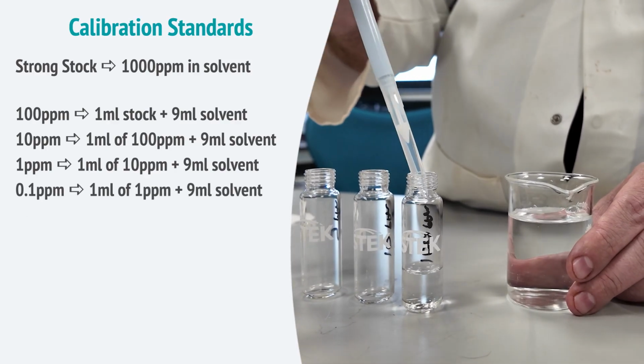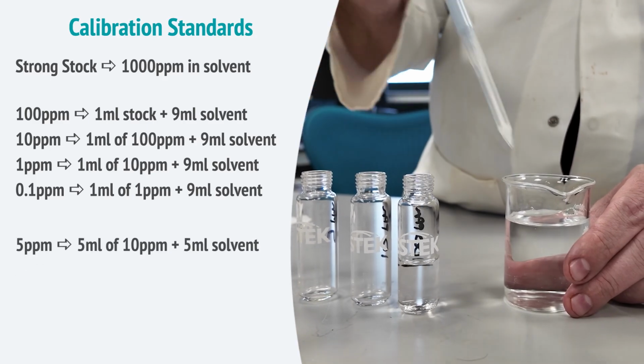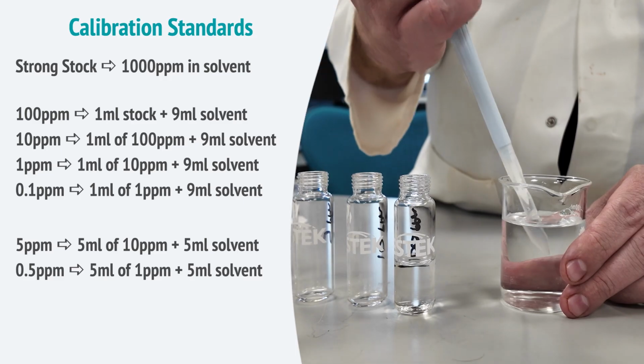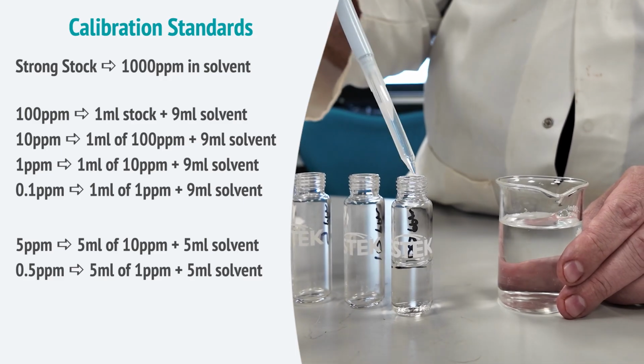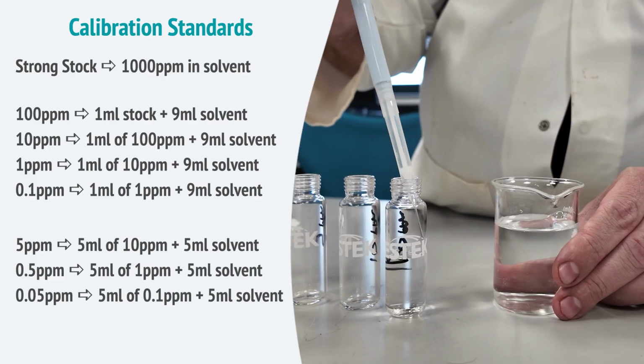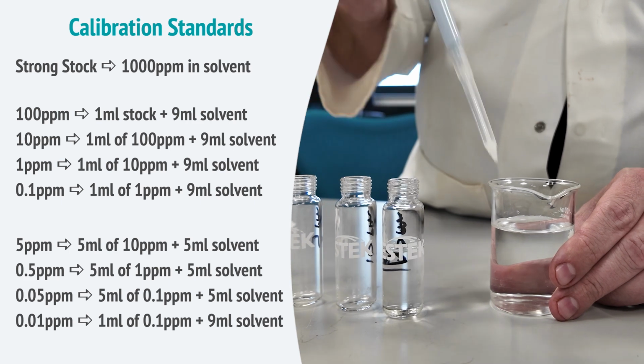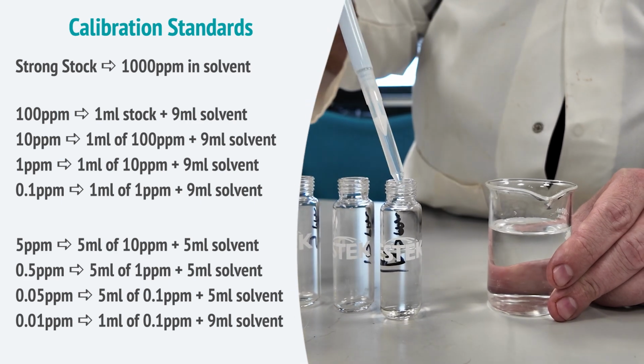Now from those, you can add the rest. To make 5 ppm, you'll mix half and half from the 10. To make 0.5 ppm, you're going to use the 1. You can make 0.05 ppm by using the 0.1, and then one final 1 to 9 step down from the 0.1 to make 0.01. By the end, you'll have a complete ladder of standards from 0.01 up to 100 ppm. Perfect for the trace levels found in beer, and you can extend higher if you need.